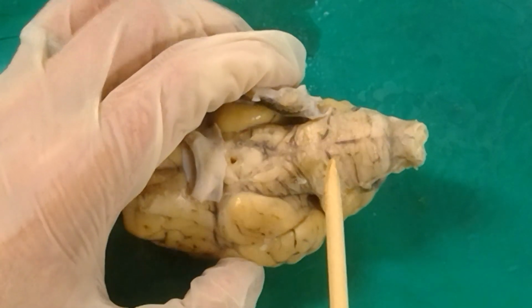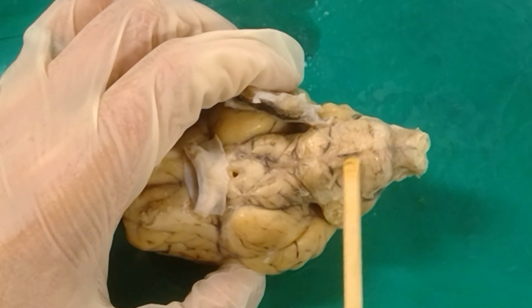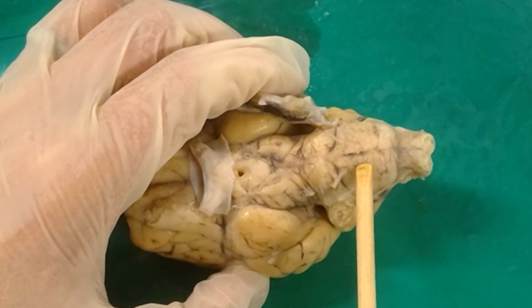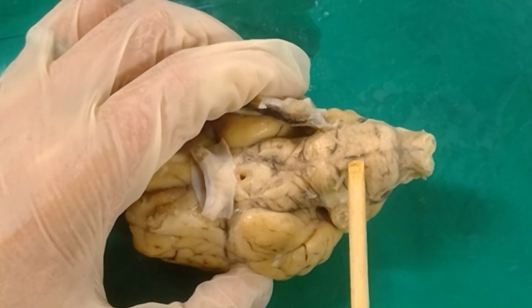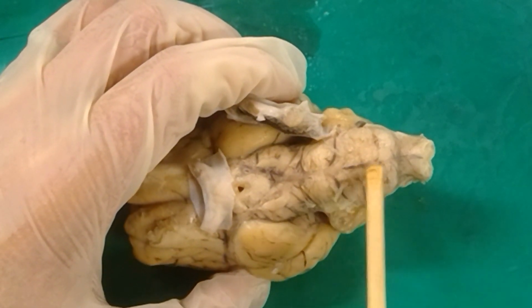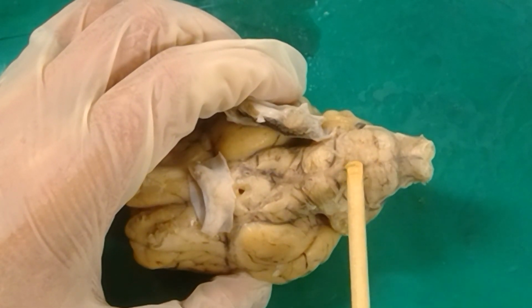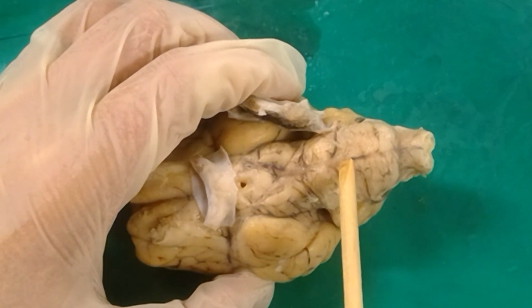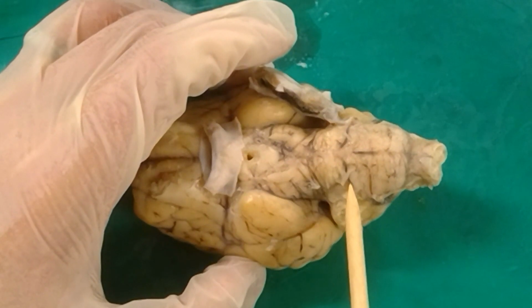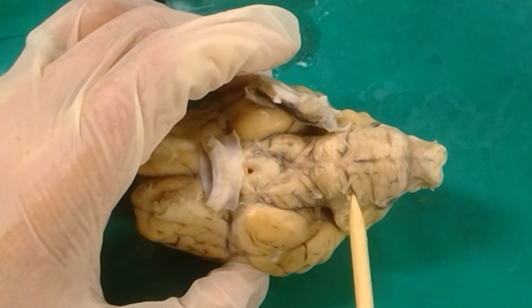There are also a couple other fiber tracts running along the medulla. The ones that go right along the midline right here are known as the pyramidal tract. If we remove the pia mater, you'll be able to see it more clearly, but there's a bulge happening right here and one right here off of the medulla. These fiber tracts are the pyramidal tract, right there and right there. They get all the way to the most front part of the medulla where they hit what's known as the trapezoid bodies, which go along right here. This is the trapezoid body running along the most anterior portion of the medulla.